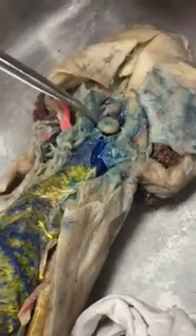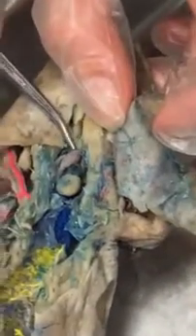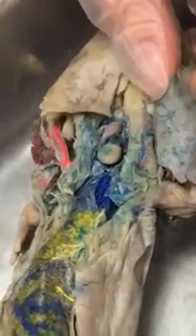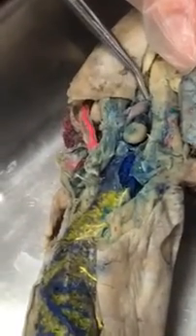Okay, so from the ventricle, where it gets skinnier is the conus arteriosus. Where it gets bigger is the bulbus arteriosus. And then you can barely see it, but you can kind of imagine the left and right branch from the bulbus arteriosus. Those are the right and left branch of the ventral aorta. It's on the ventral side, okay? And if you put the probe under there, you can see that.